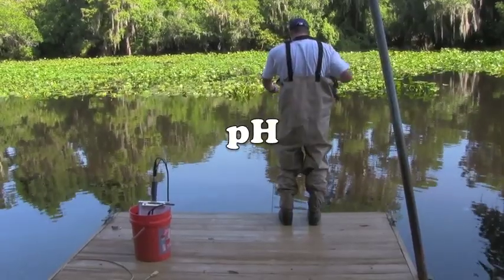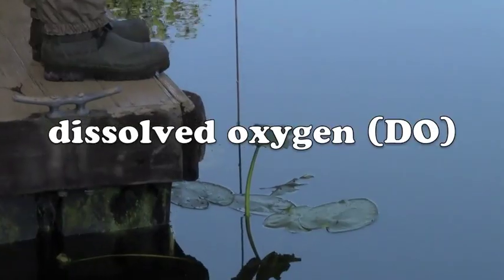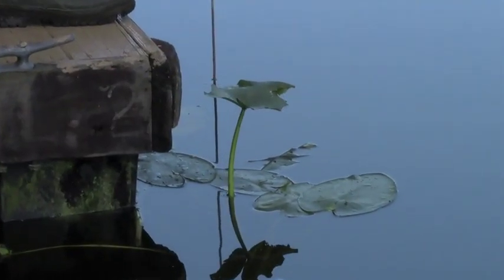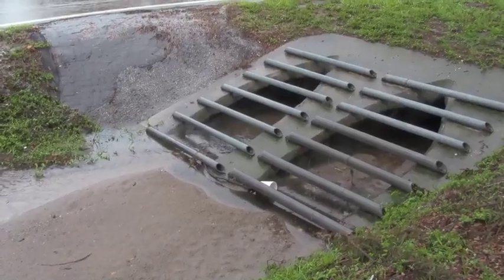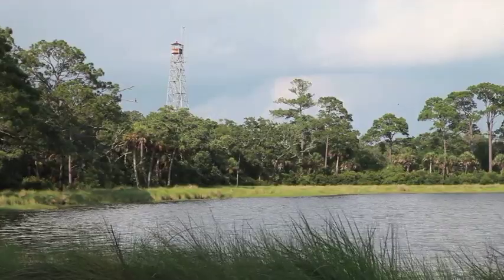Turbidity, pH, temperature, and DO are just a few of the parameters scientists measure to determine water quality in an effort to protect water from pollution and prevent harm to people and the environment.